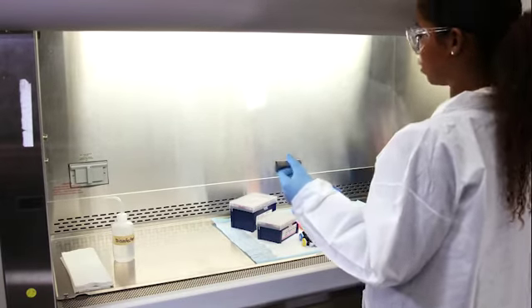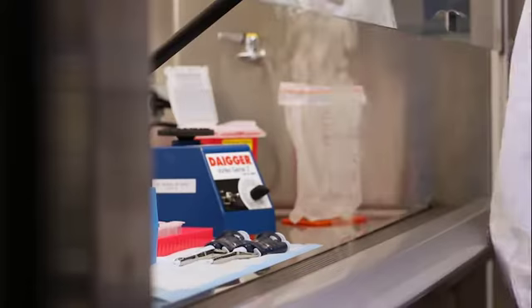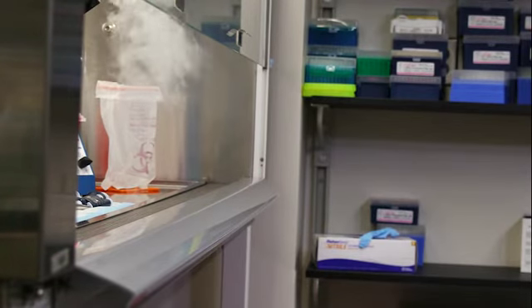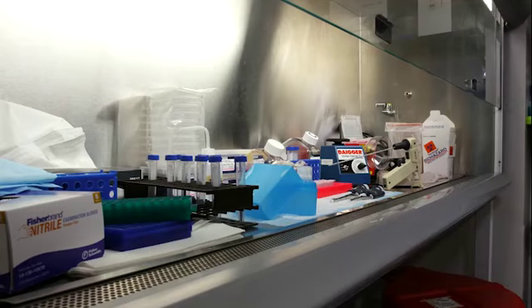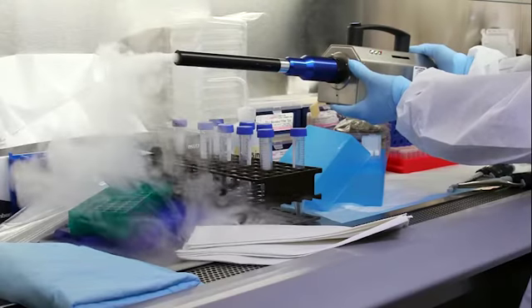Even when the sash height is correct, the air barrier at the opening is fragile, approximately 100 feet per minute or 1 mile per hour. It can be easily disrupted. Something as simple as the way you withdraw your arms or a person walking too close to the cabinet can pull air and potential contaminants out of the cabinet and into the breathing zone of the person working in the BSC. One common mistake is overloading the inside of the BSC with too much equipment and/or supplies, or covering the front or rear grills.